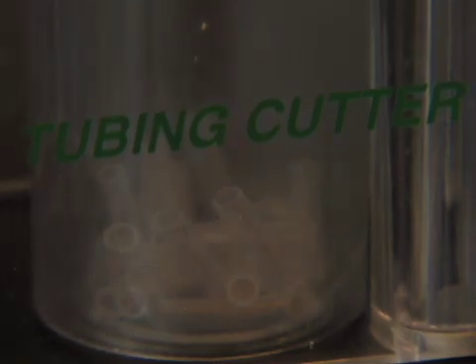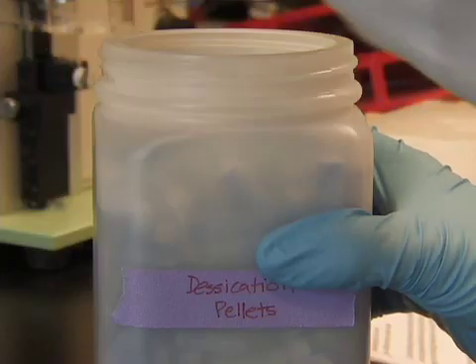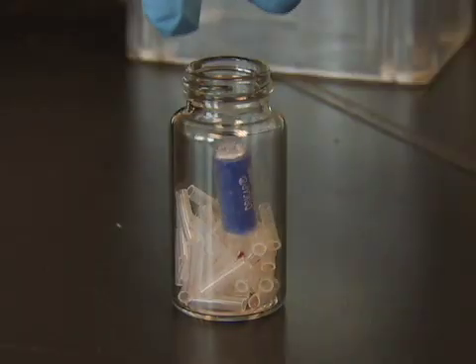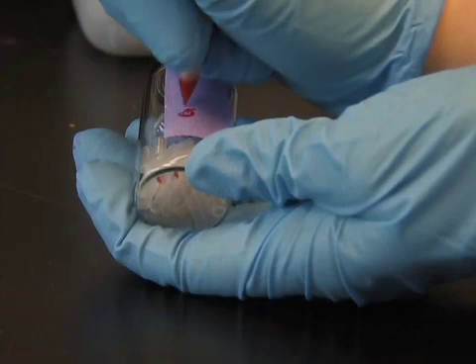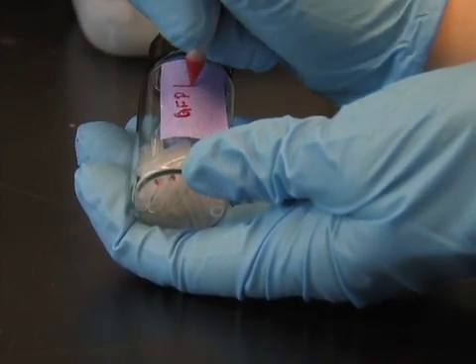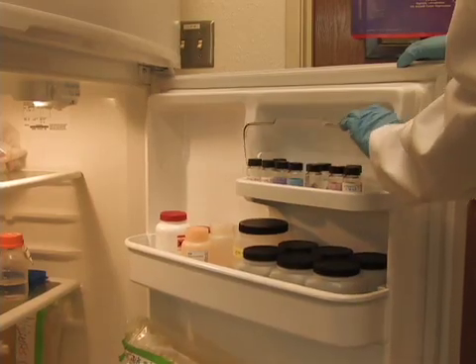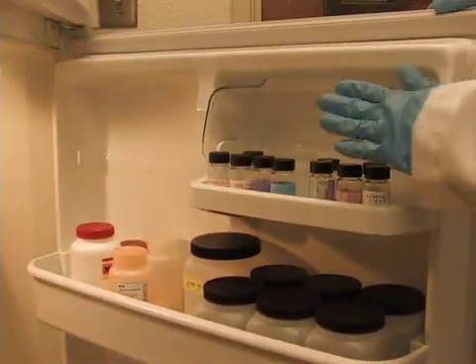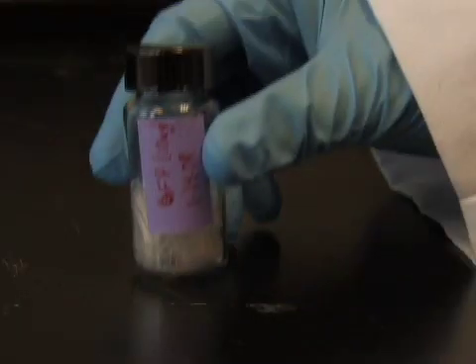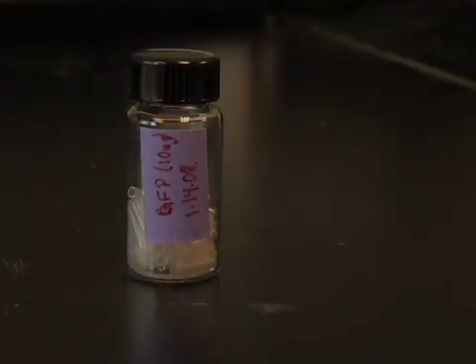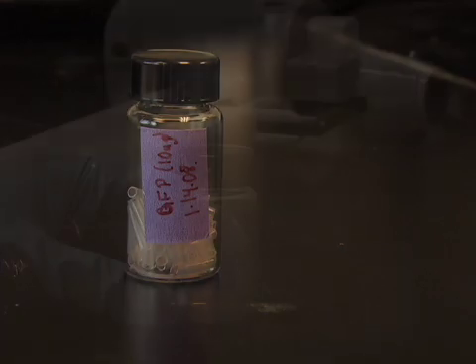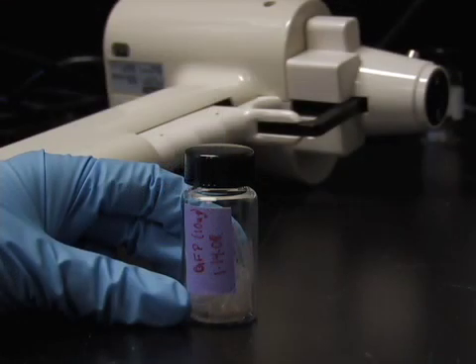Once the tubing has been cut and collected in the scintillation vial, place a desiccation pellet in the scintillation vial. Bullets are good for up to 6 months, but after 2 to 3 months may begin to show a decrease in transfection efficiency. So it is good practice to label the vial with the construct name and date. Bullets can be used immediately after they are made or can be stored at 4 degrees Celsius. If you are using bullets stored at 4 degrees Celsius, let the scintillation vial warm at room temperature for about 15 minutes before opening in order to prevent the bullets from absorbing moisture. We are now ready to shoot the DNA bullets using a gene gun.